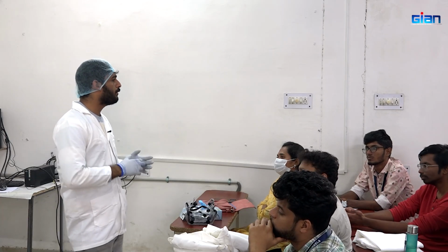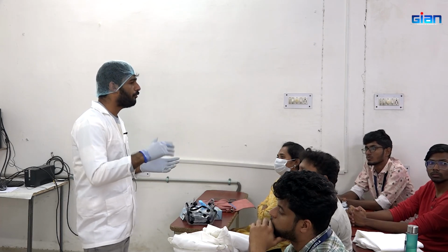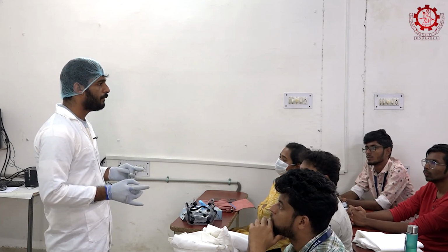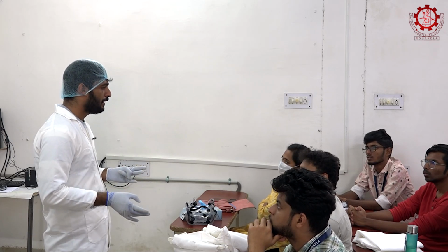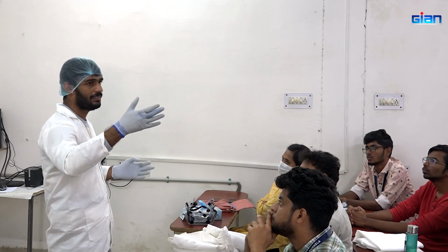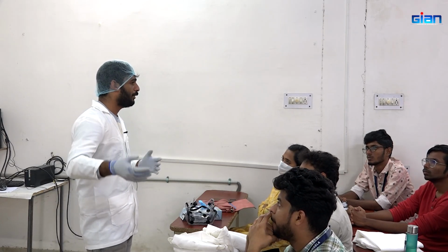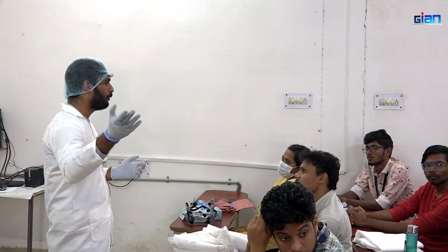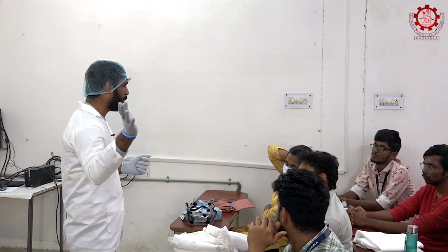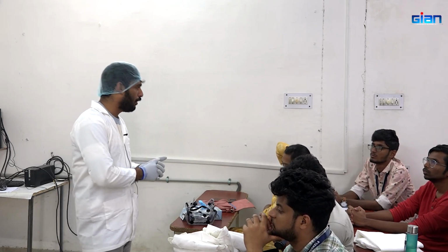So now we are going to wash the dissolved fraction in order to remove. Why are we going for washing here? What's the need of washing? After demineralization, remove the HCl, okay. So for removing the HCl, we will be going for washing. Some fraction I have washed already because we don't have enough time to wash continuously. Anyway, I will show you how to clean it, and after removing the debris and other matter, we will be washing and taking the dissolved fraction.